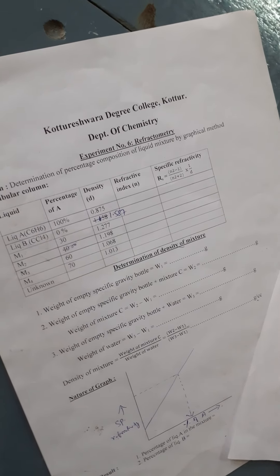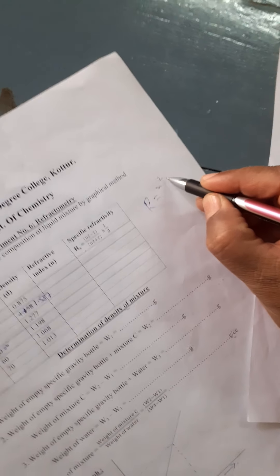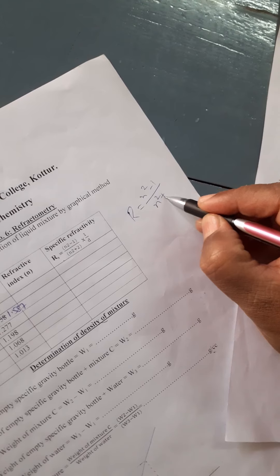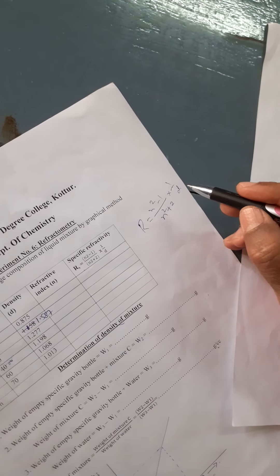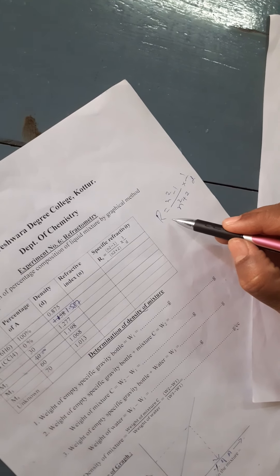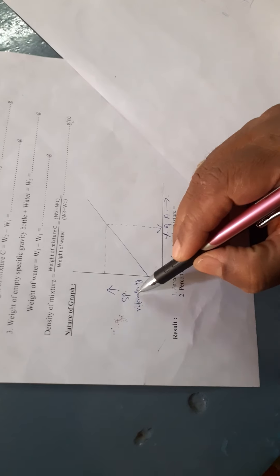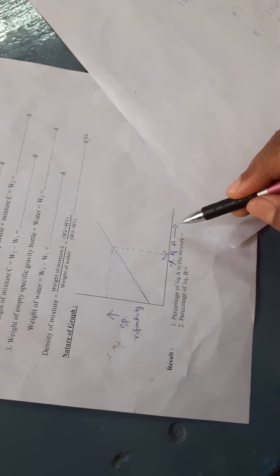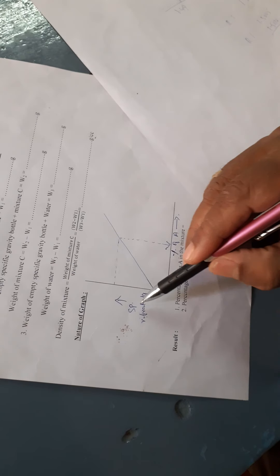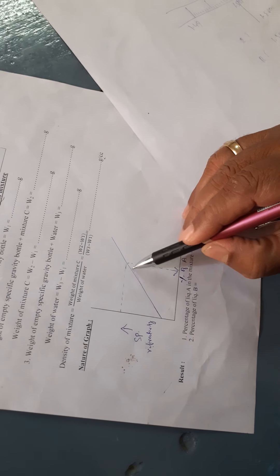After knowing the density and the refractive index, calculate the specific refractivity using the formula: R equals (n² − 1) divided by (n² + 2) multiplied by 1 over density. After calculating specific refractivity values for all liquids, plot a graph of specific refractivity along the Y-axis versus percentage of A along the X-axis. A straight line is obtained.